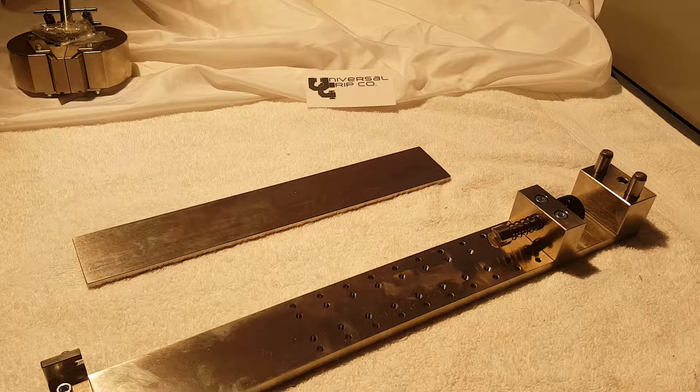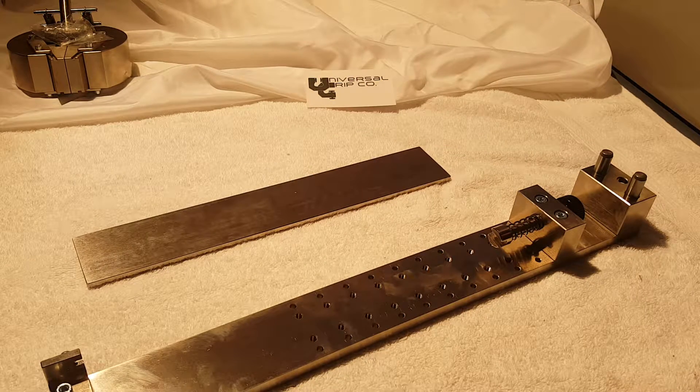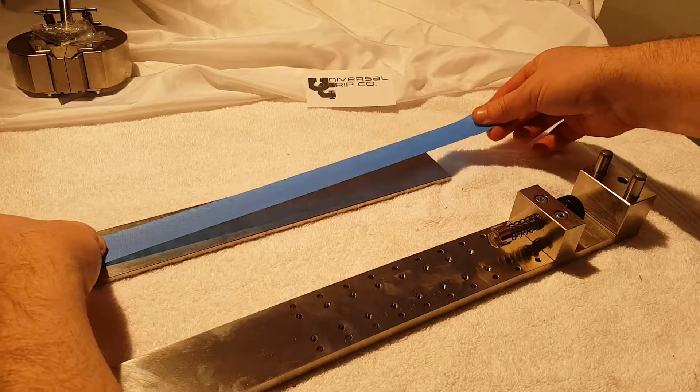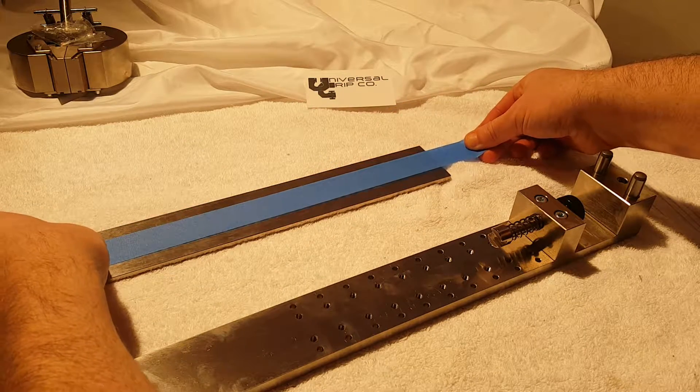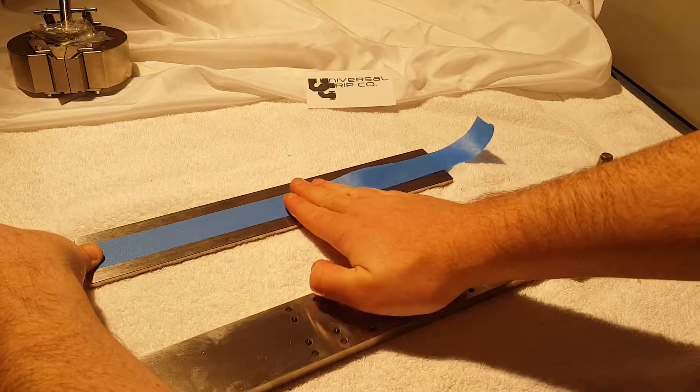Let's go ahead and get a sample loaded onto the steel plate here. I have some masking tape here, nice blue so you can see it.